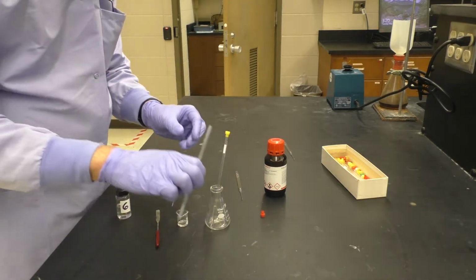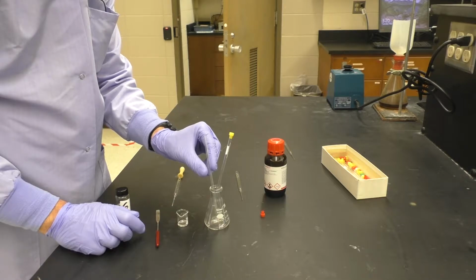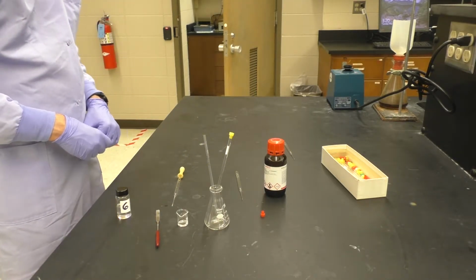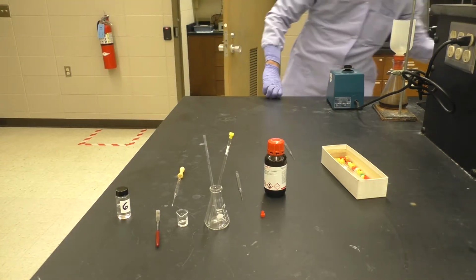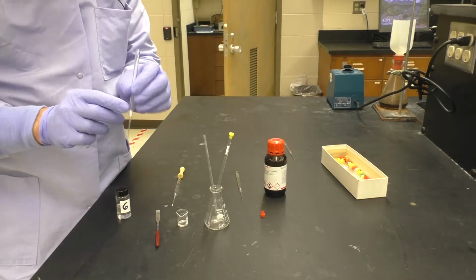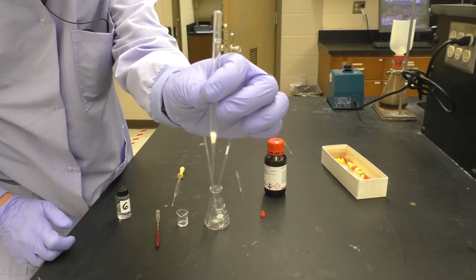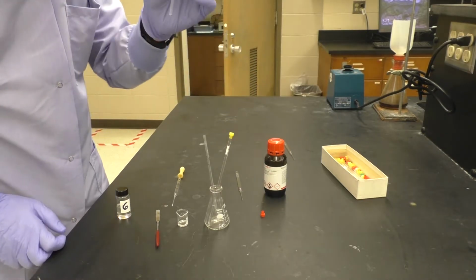So here we'll take our NMR tube we're going to prep the sample with, place that there. We can get an NMR filter, or a pipette filter actually. A pipette filter is simply one where I have taken a pipette and a small amount of cotton, stuffed it down into the bottom of the pipette, and then when I transfer material down through that, that will filter out any solid materials.